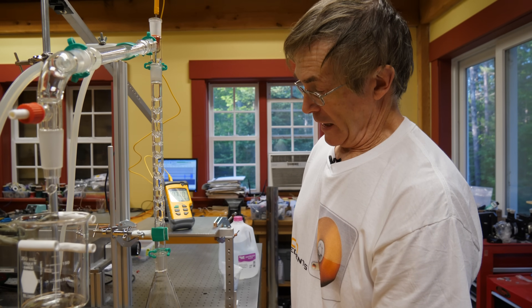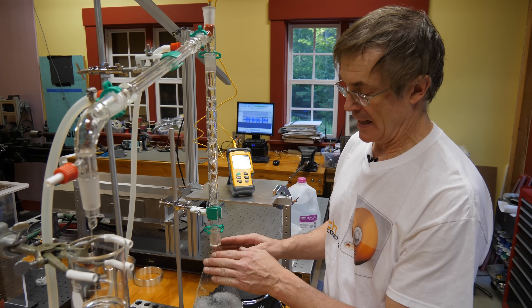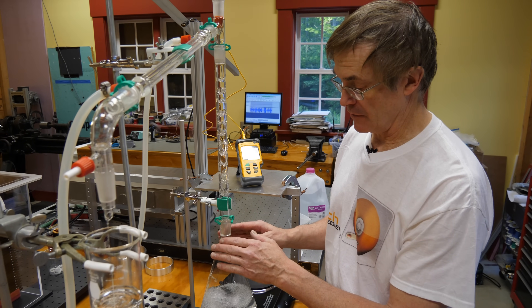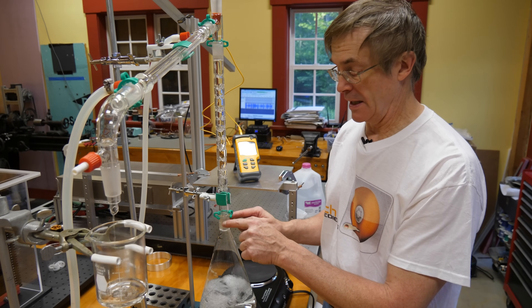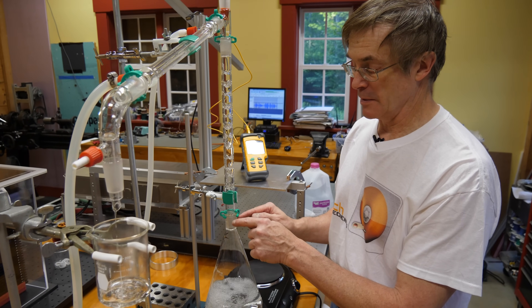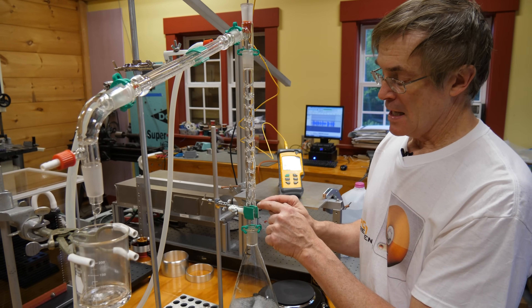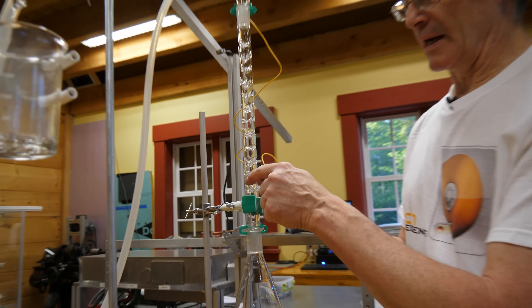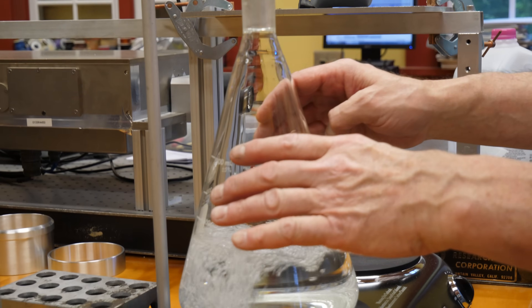Now that the liquid is boiling, vapors are going up and as soon as they touch the cooler glass higher up, they become denser and heavier, and if they lose enough energy they'll condense and drip back down. In the process, the glass warms a little bit, and progressively the molecules that follow find the glass slightly warmer and go a bit higher before condensing. This cycle of heating, vaporization, contact and cooling, then dripping back down is called reflux, and it occurs with both water and alcohol.